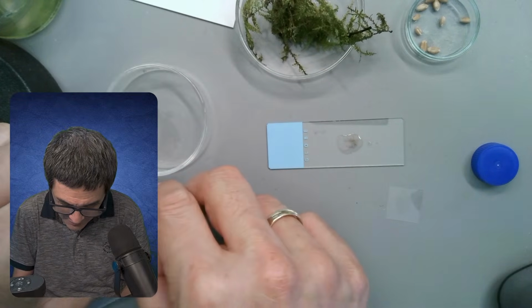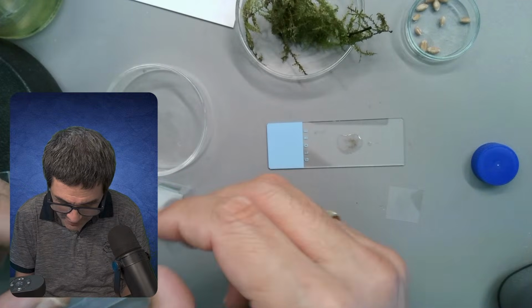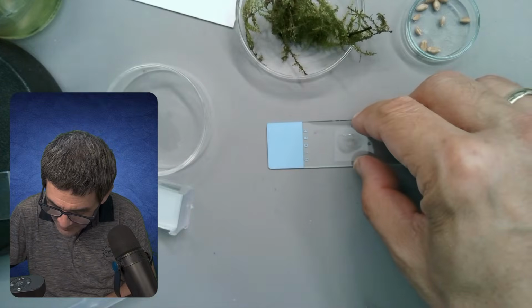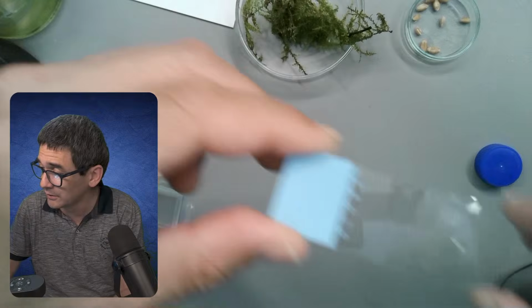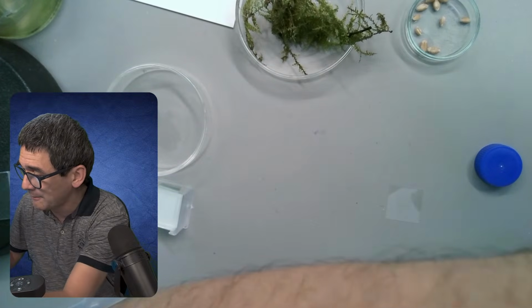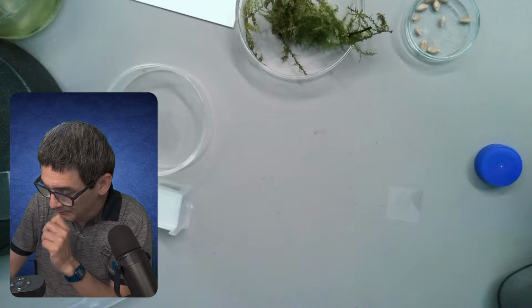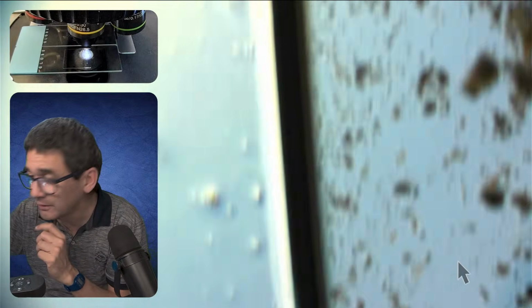So I decided to therefore grab a couple of water samples again, especially when the temperature is so high as it's been, and usually this favors the growth of algae. Okay, and let's have a look at this one now. You know what, I'm just going to leave the other slide in here. So that's the old one. So let's have a look now over here.